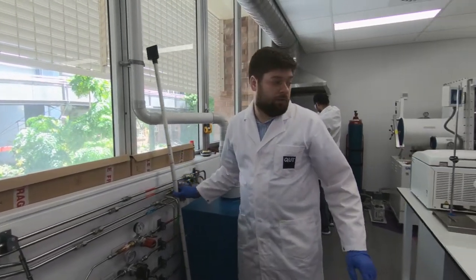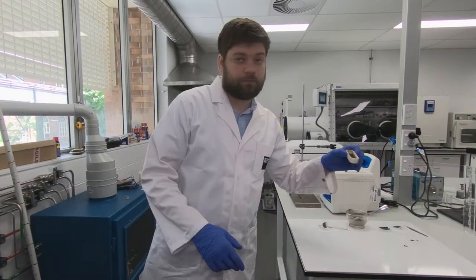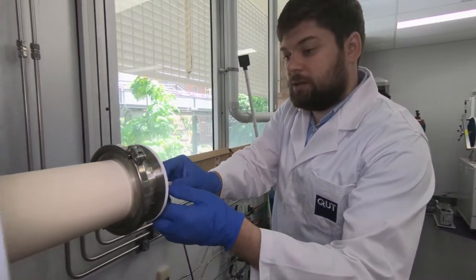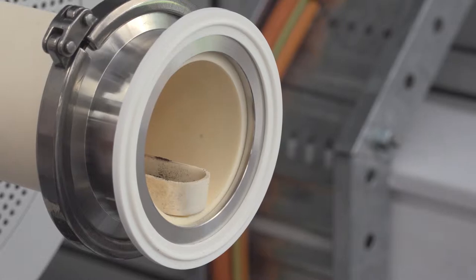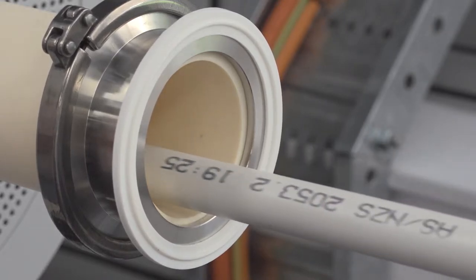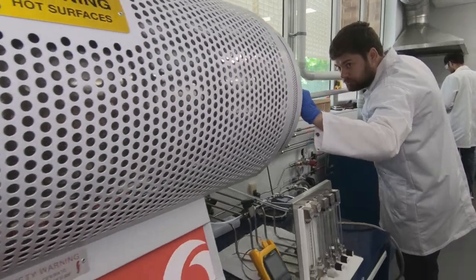And now when this part is ready, we can transfer our powder mixture inside. And this powder mixture needs to be put in the zone with lower temperature. So we put it inside only for 40 centimeters.